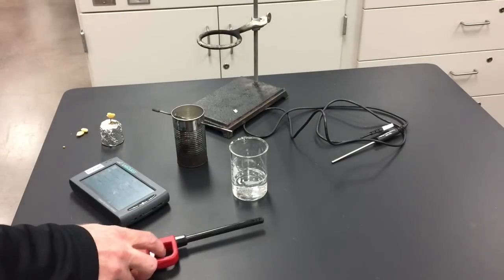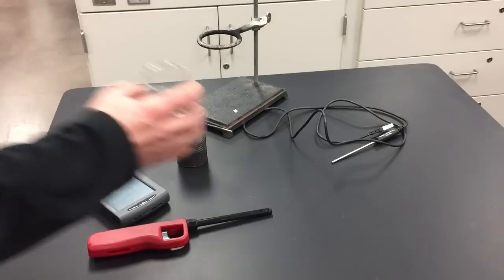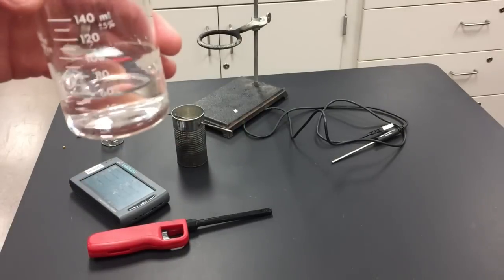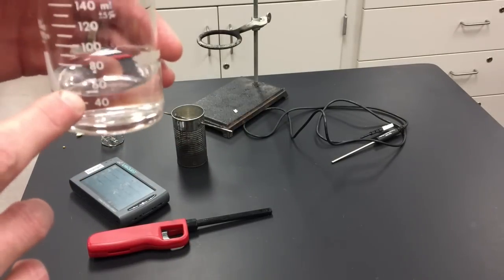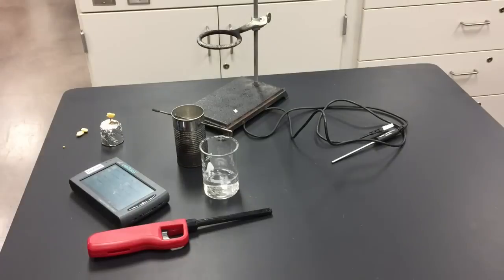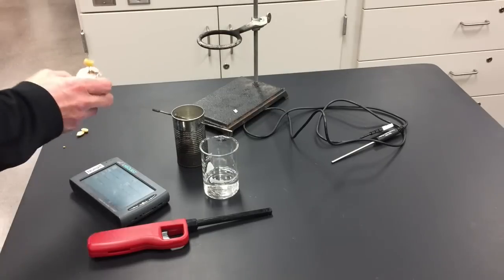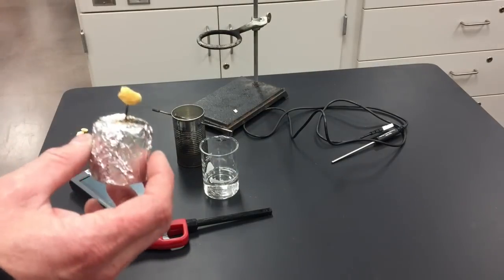Matches or lighter, some water. I just use cold water from the tap and I poured about 50 milliliters. Alright, so data you're going to need before you get started would be to know how much the food sample weighs.